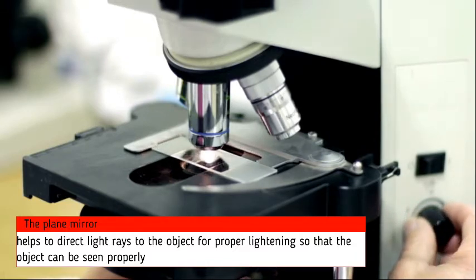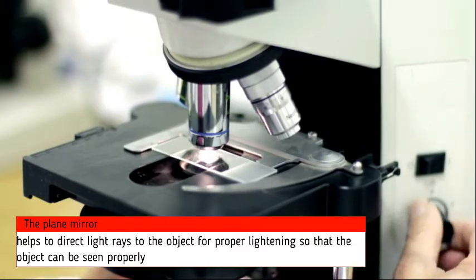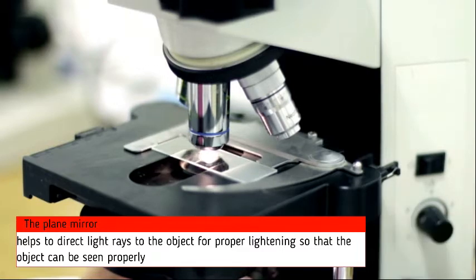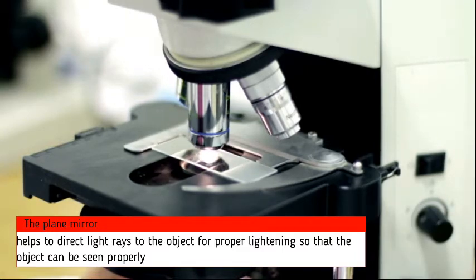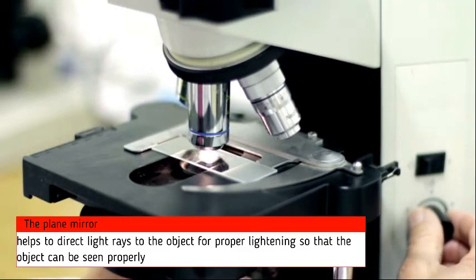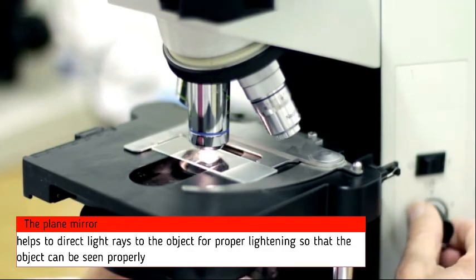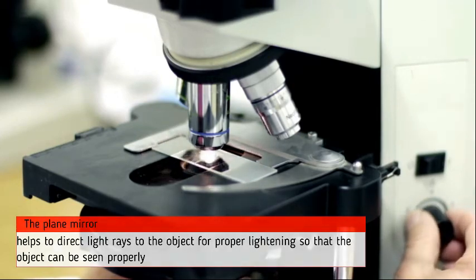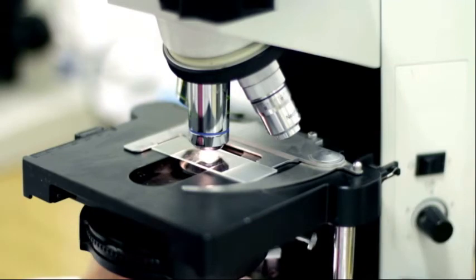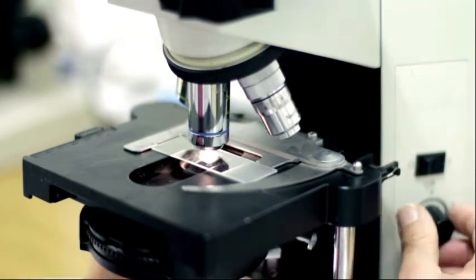The plane mirror helps to direct light rays to the objects for proper lighting so that the objects can be seen properly. It is not something you will see very prominently, but it redirects and concentrates light so that objects can be properly seen.